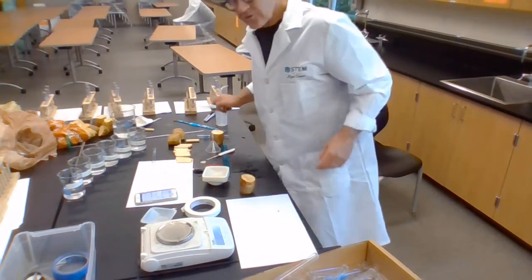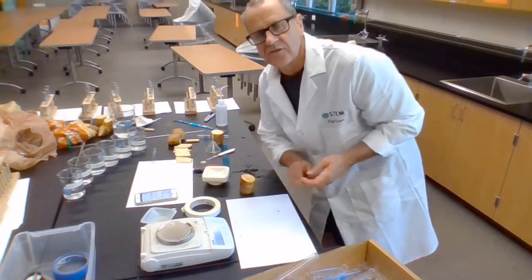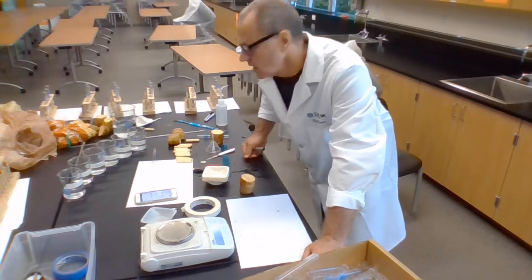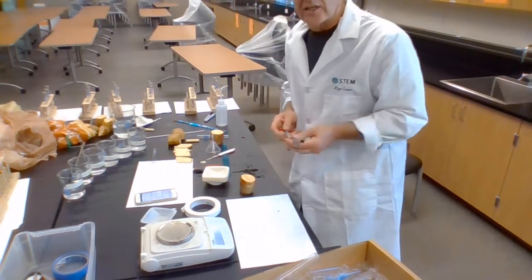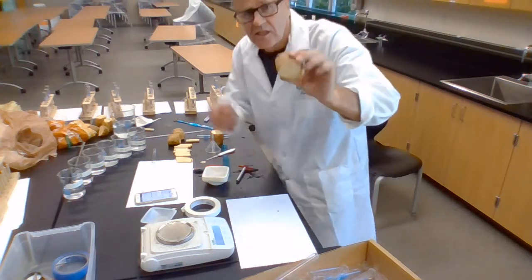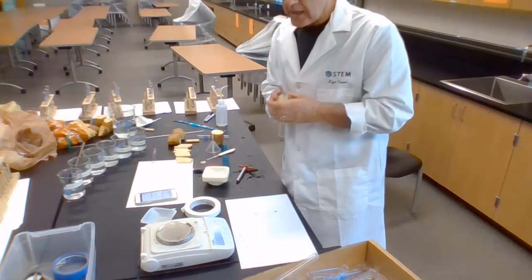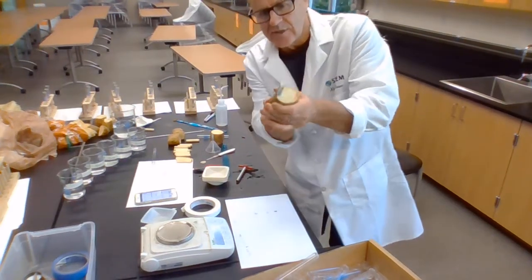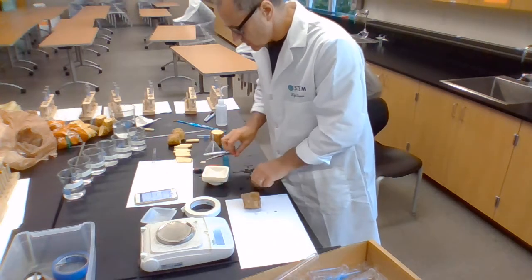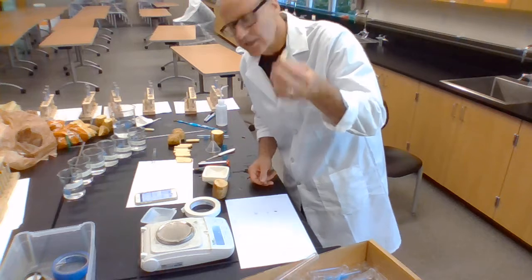And so, unfortunately, I forgot my very large kitchen knives at home. I have this beautiful set of extremely sharp Shuns, which means I'm constantly bleeding when I cook. But I forgot those. And so I found these cork borers. And here's how I use them. So here's a potato, here's a cork borer. I place it through there and avoid the skin because I don't want any skin on it. If I get skin on it, then it's not going to take in or give out water as easily as if it didn't have skin.